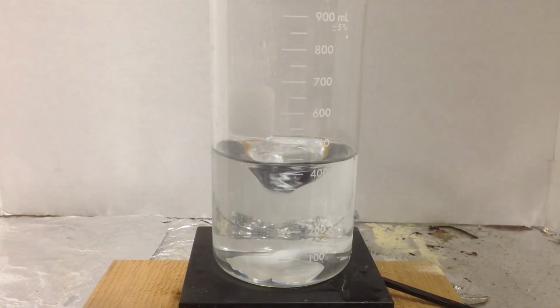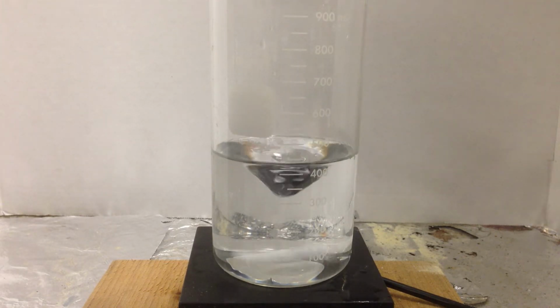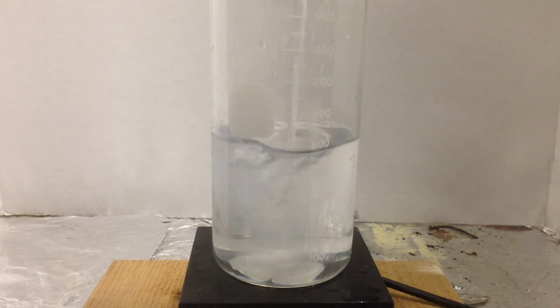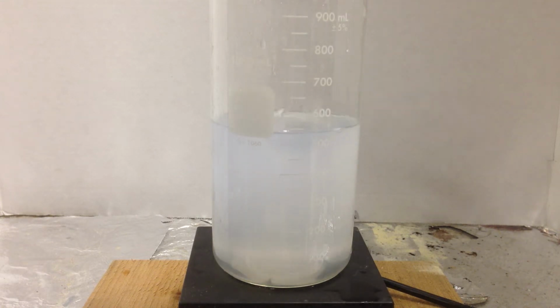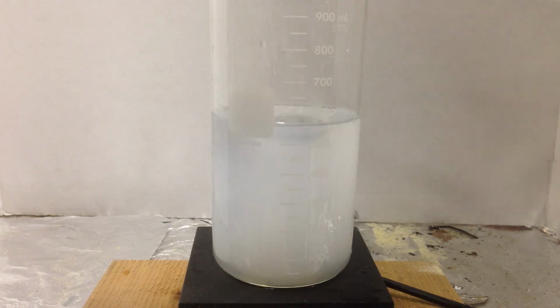Okay, so let's add some more base, and let's recreate the scenario where I'm going to have some zero charged. Okay, now I had some acid probably left over. Okay, not enough. Added too much acid. And I'm still getting there. All right, there I'm back.